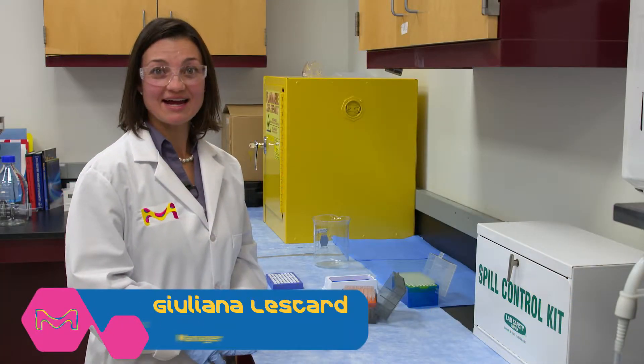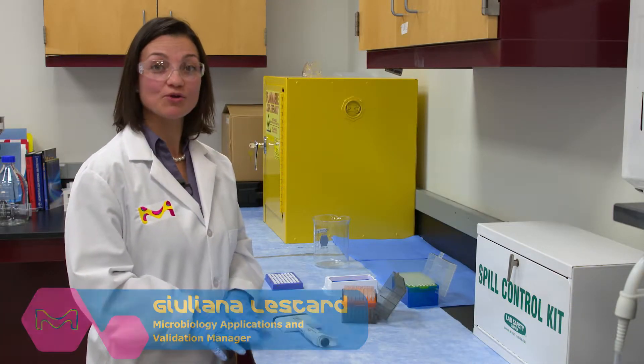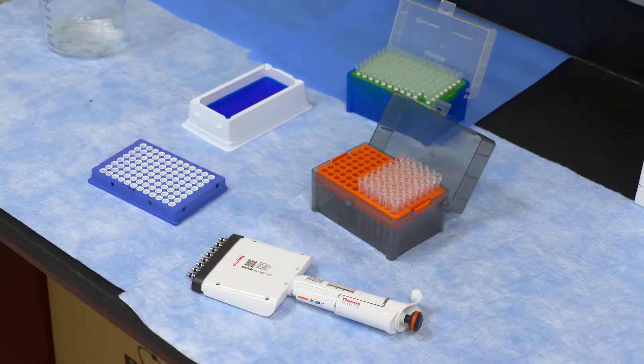Hello, my name is Juliana Lescard and today I'm going to be showing you how to best use a multi-channel pipetter.